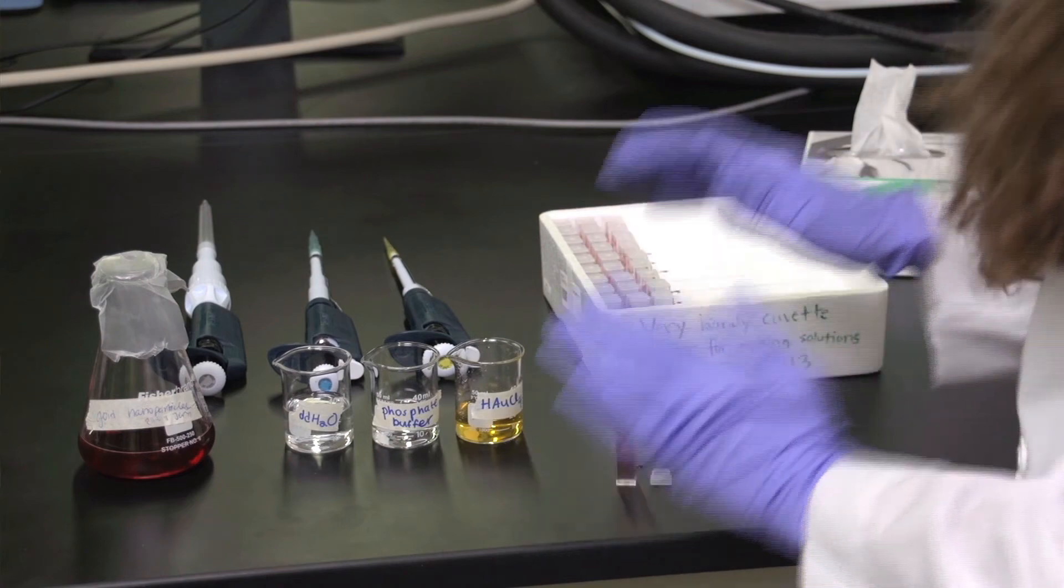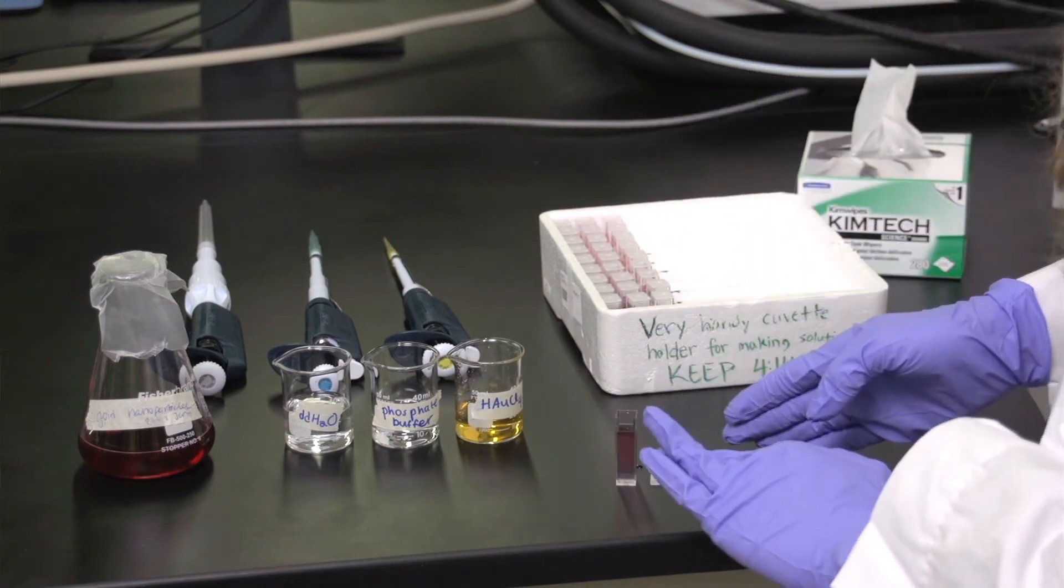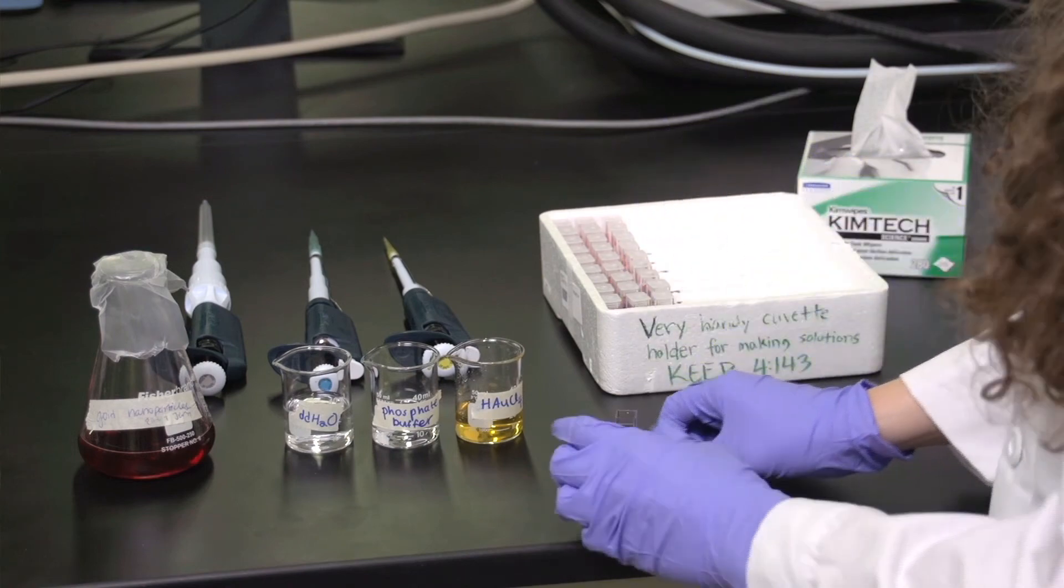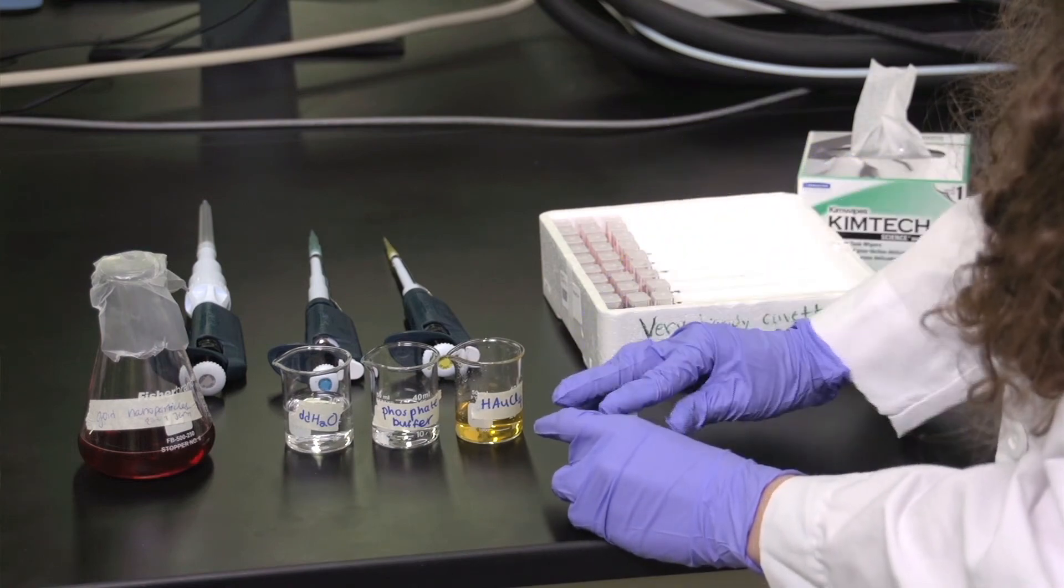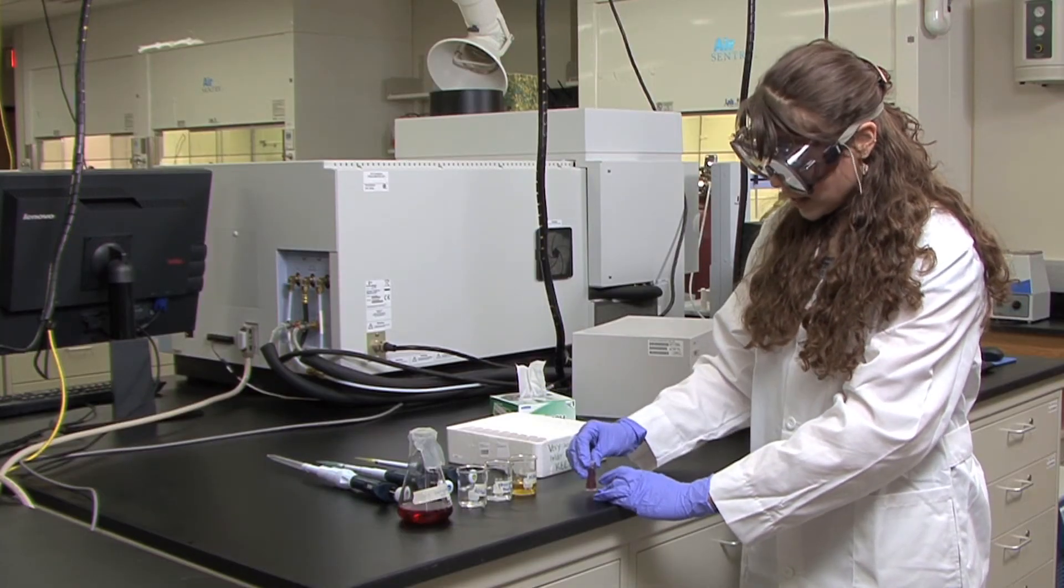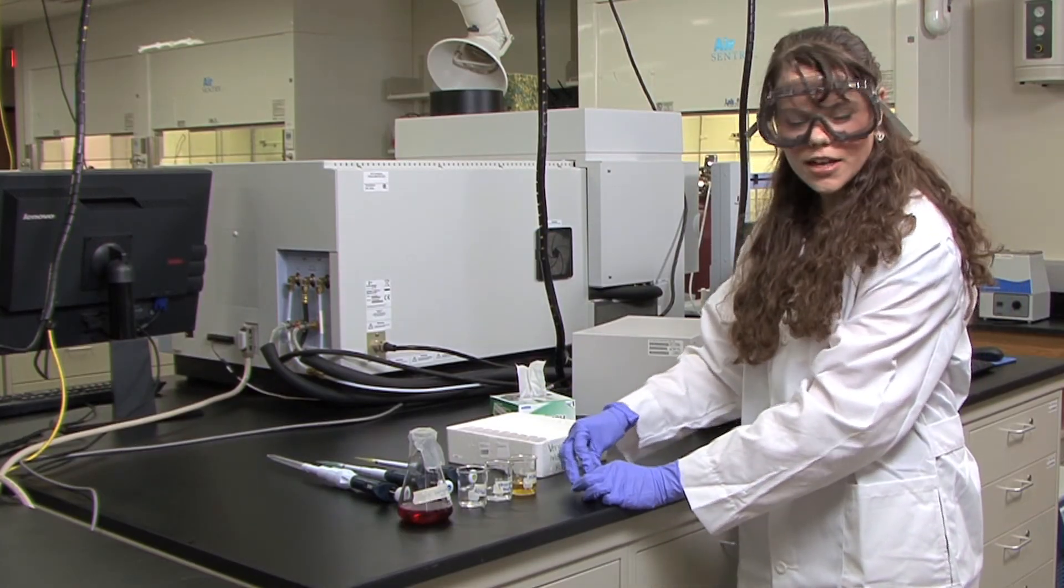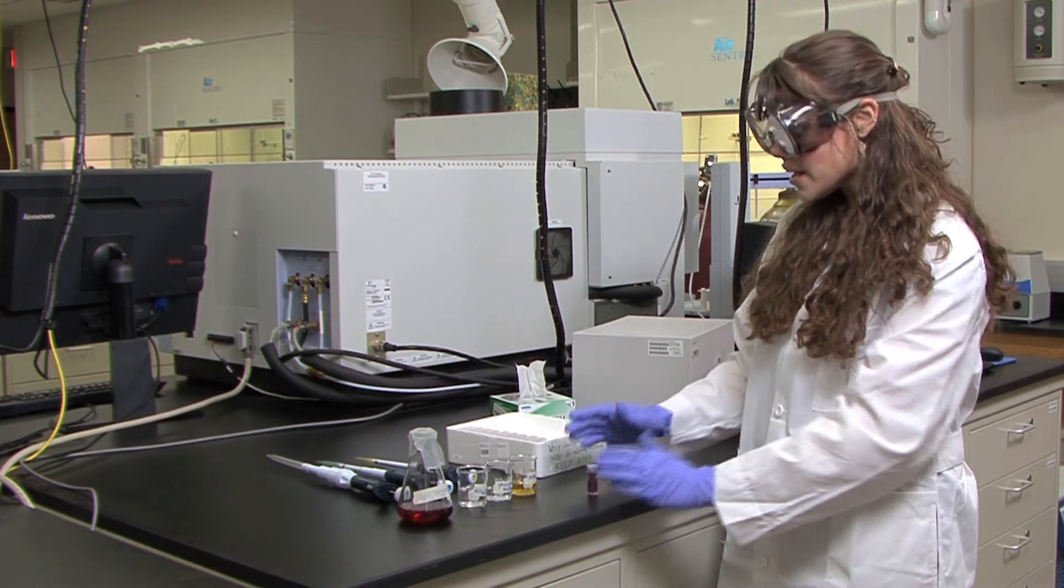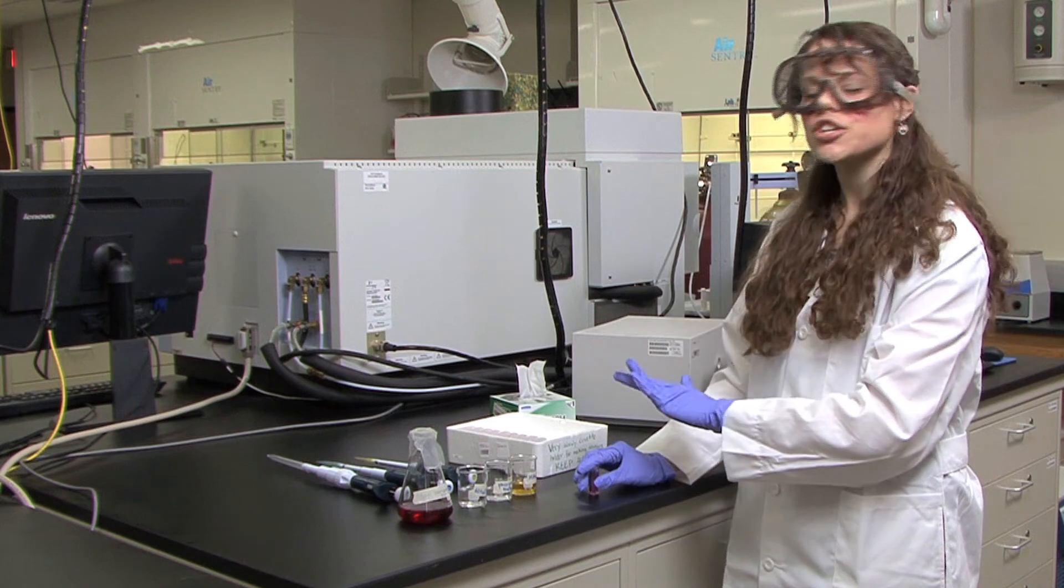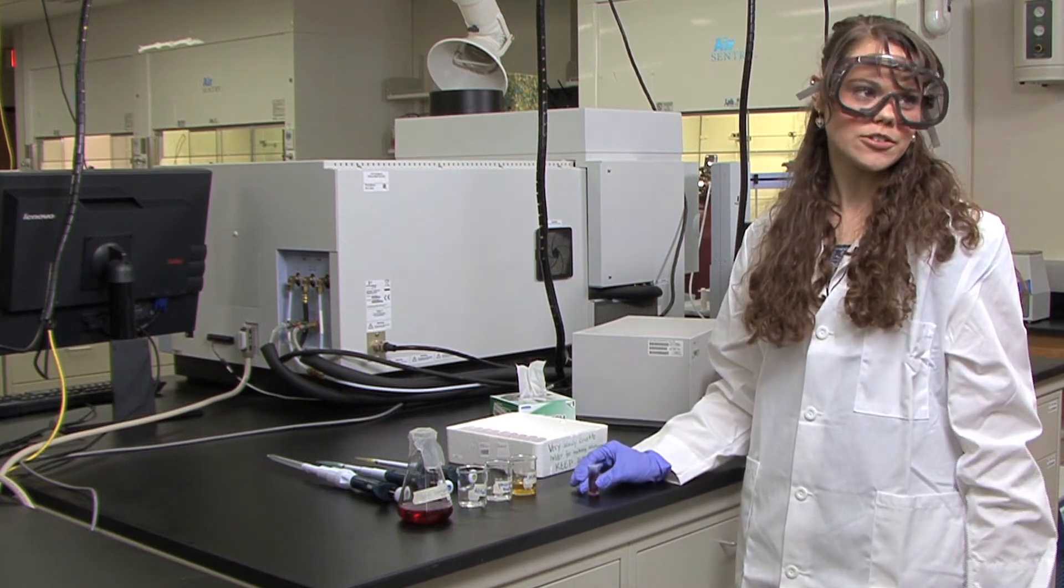If you are adding hydrogen peroxide solution to this cuvette, it is important that as soon as you add the hydrogen peroxide to the cuvette, you cap it and invert it very quickly. It is also important to note that if you are adding the hydrogen peroxide, after you cap and invert, you let the reaction go for five minutes before collecting the sample spectrum.